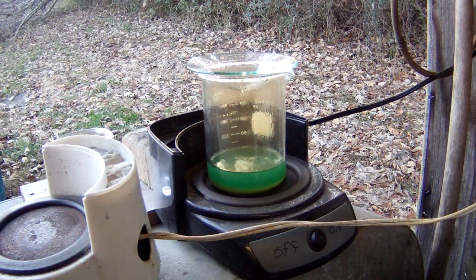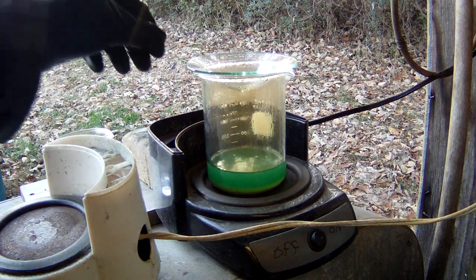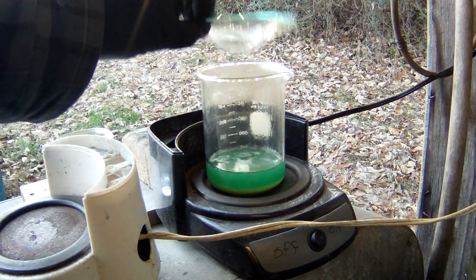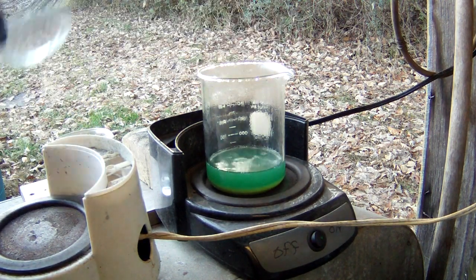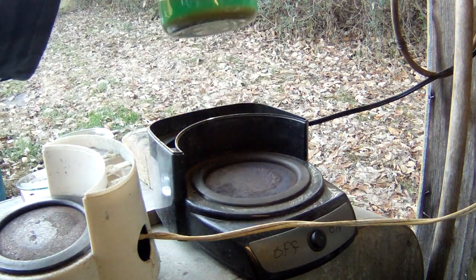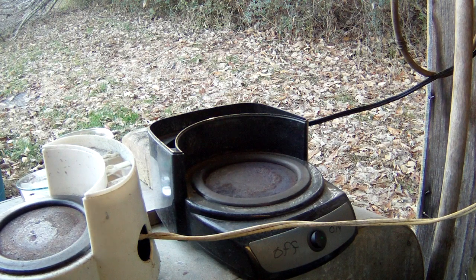Okay guys, it's been about another half an hour or so. We're still having a pretty good reaction. I do, however, want to take a look at what's in here. See what's left. We've got kind of a weird little, almost rusty looking color in there. Still have quite a bit of metal.